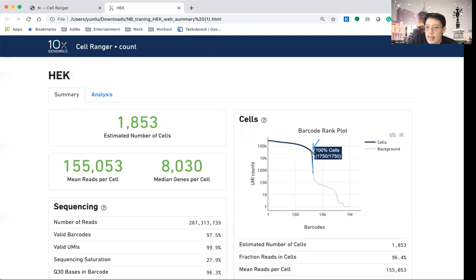So if we move to here, there are about a few thousand barcodes where the number of reads goes beyond it. Maybe here it's like 20 or 30,000. So this is the number that is showing here. You want to see this sudden drop, because in one scenario that I'm giving you, a very bad scenario, your cells are all burst, and all the RNAs are floating around within your tube. And then when you trap those bubbles, each bubble will still, by random, trap some of the floating RNA or ambient RNA.